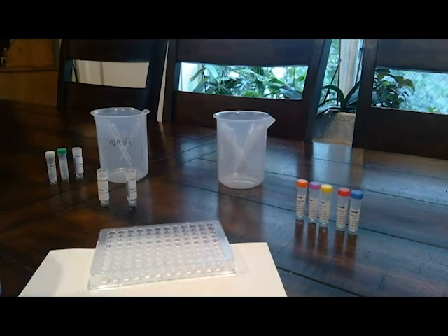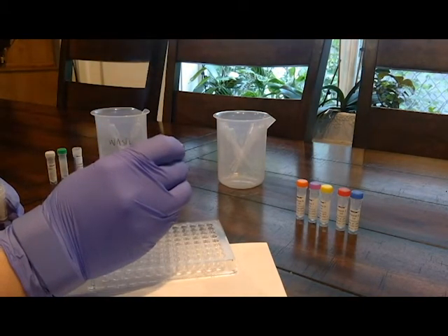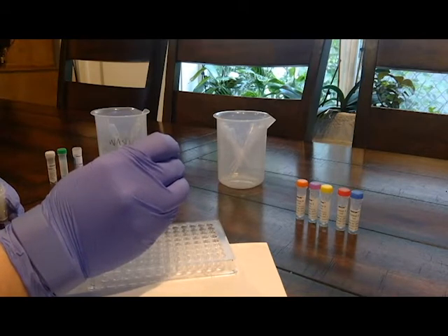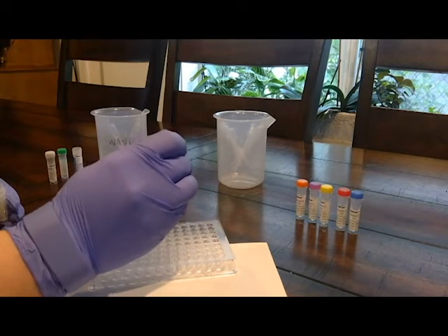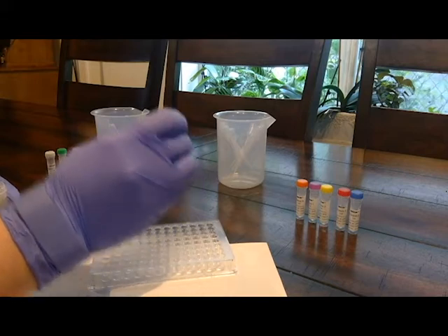So patient A to A7, A8, and A9. 1, 2, 3, 1, 2, 3, 1, 2, 3.